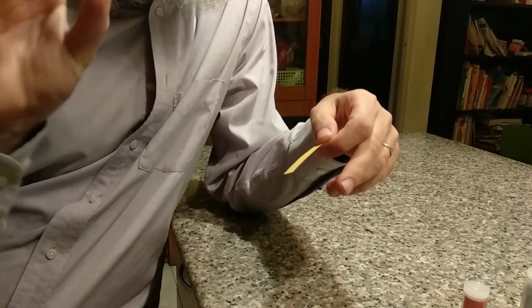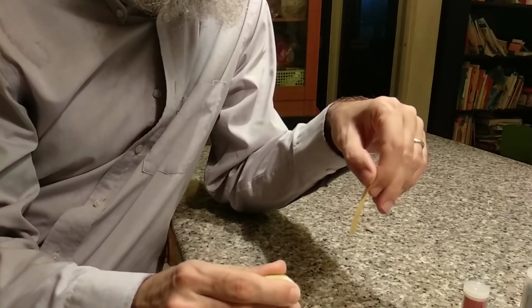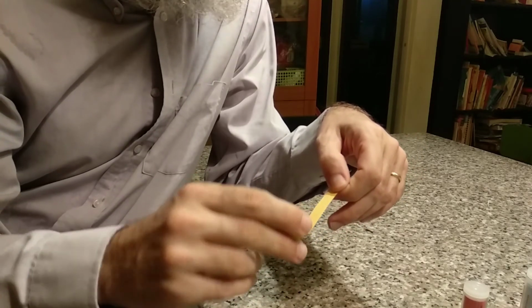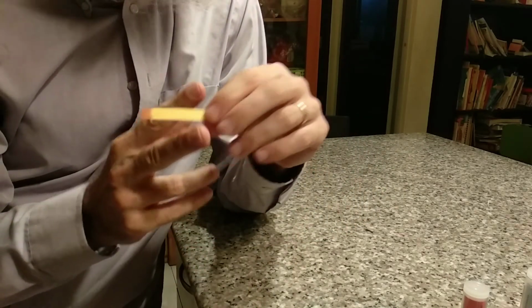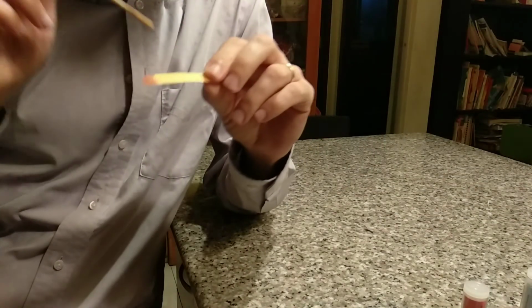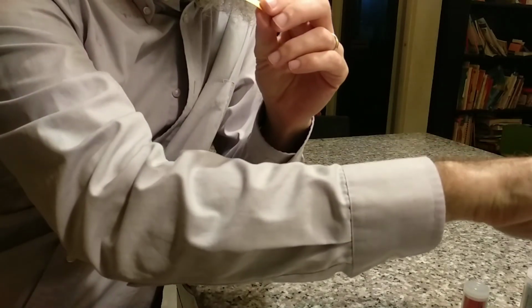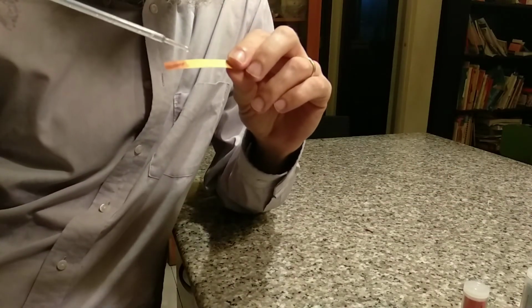Okay, so I have some lemon juice here, and if I get some of that juice and I put it on the end of my universal indicator paper, it turns it red. Okay, then if I take some of my vinegar and put that next to it, similar but a little more orange. Then next to that, I'll put a bit of water.